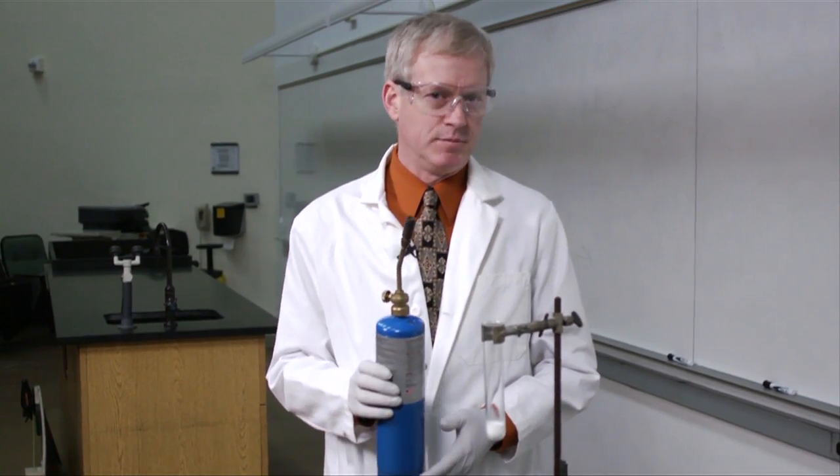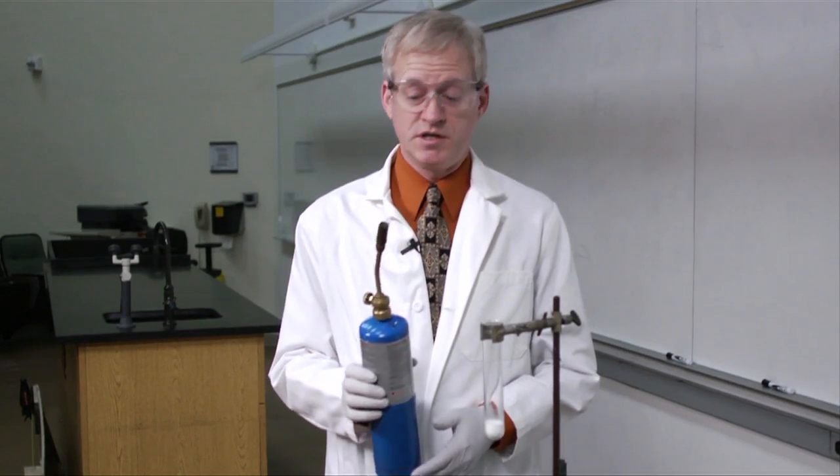To make things more interesting, let's heat the potassium chlorate with this torch until it liquefies.